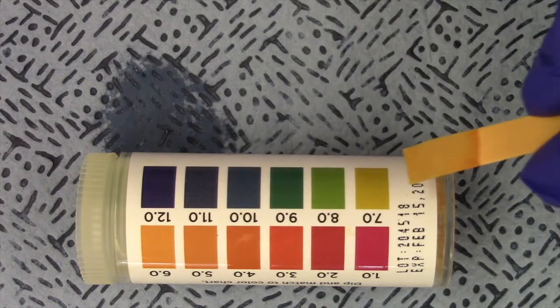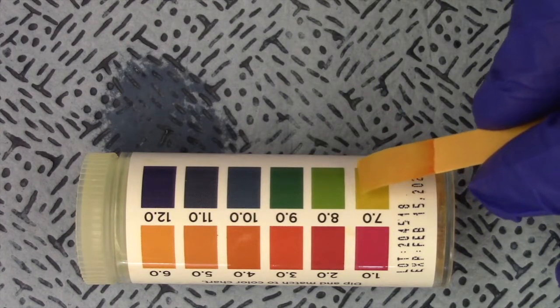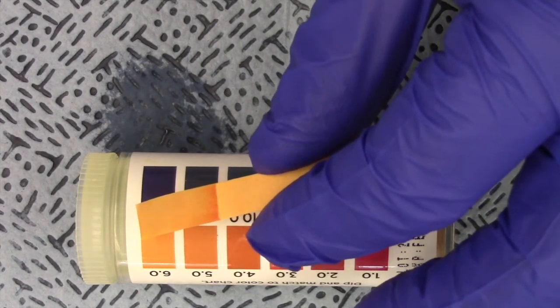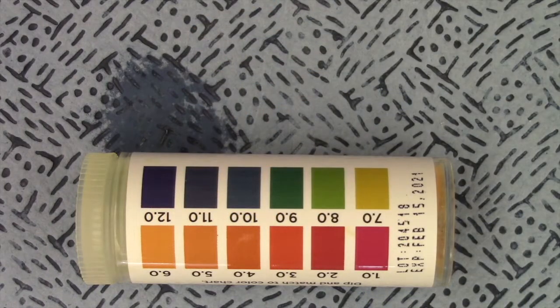All right, now water should be neutral, but if the water is not completely pure, or if it sat out overnight, it could be a little acidic, and I think today's water is somewhat acidic. It's pH 6. If you want to read the color, it's right around pH 6, but that's okay. Just write down what you see, pH 6. Should have been neutral, but hey, can't have it all.